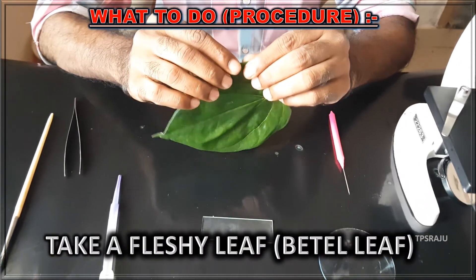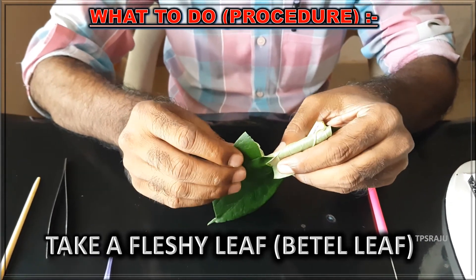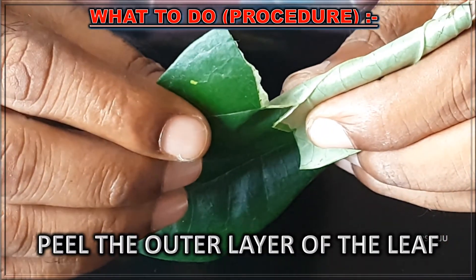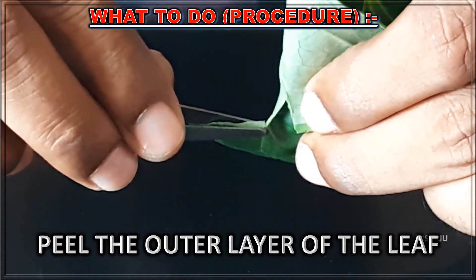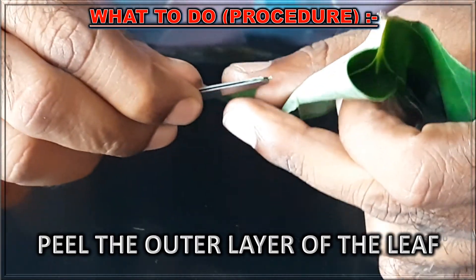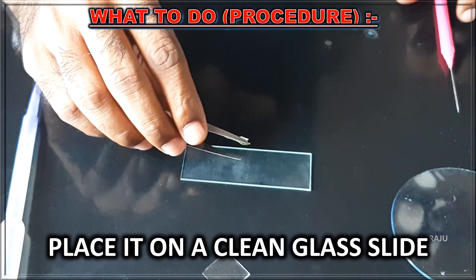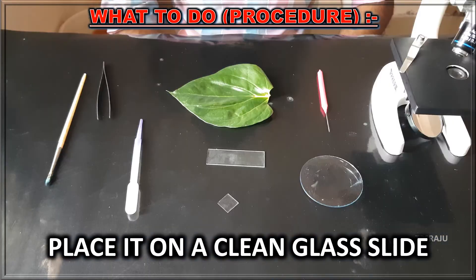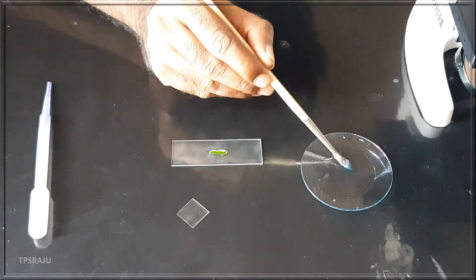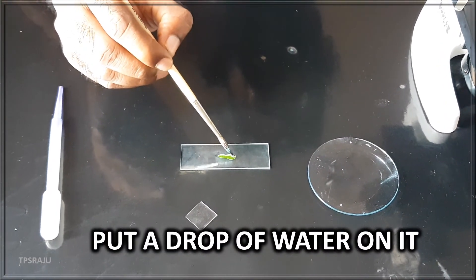First we have to take a fleshy leaf — here we take a betel leaf. Peel the outer layer of the leaf. Place it on a slide. Put a drop of water on it and observe under the microscope.